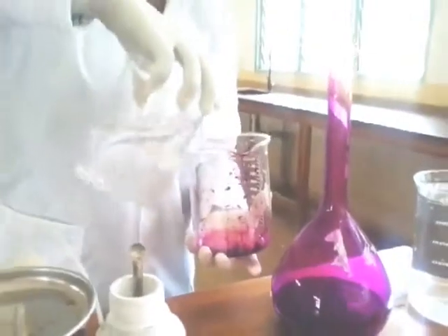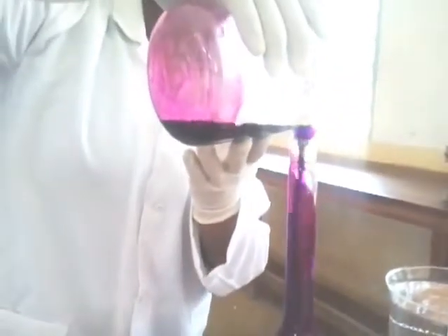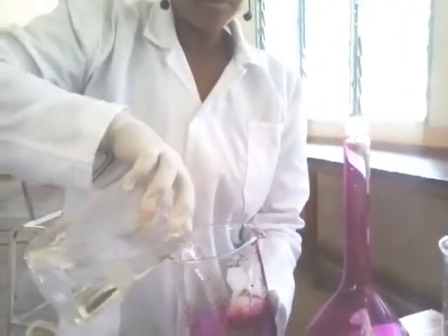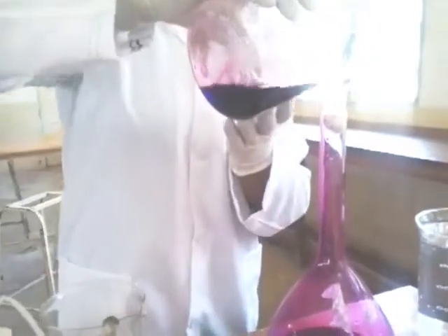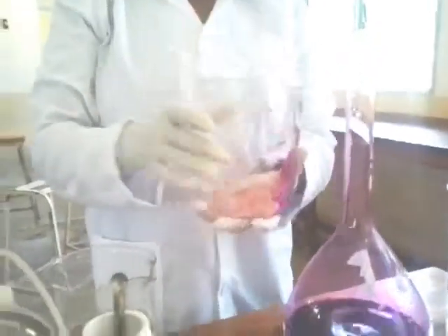After that, we wash the beaker using distilled water and add the washings into the volumetric flask. We wash the beaker twice or thrice until all the solution and particles are removed from the beaker.